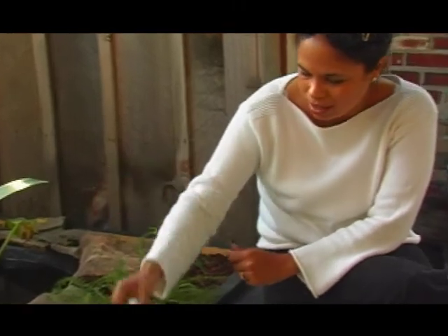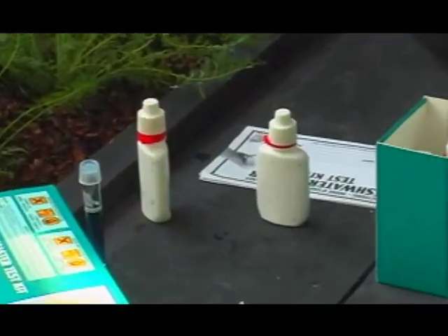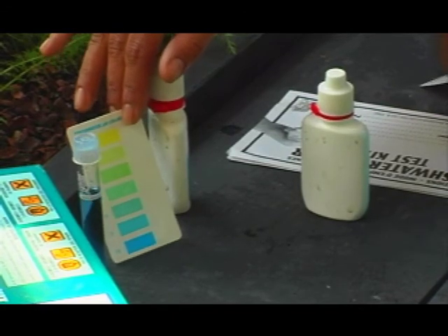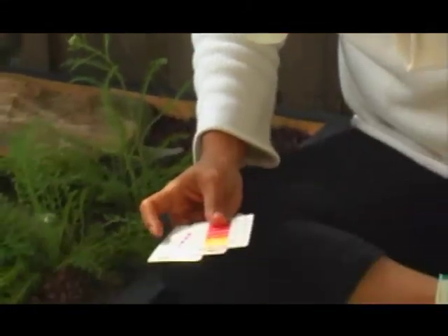That's already giving me a very, very blue reading. We're going to check this little color card and I'm going to say that we're at a 7.6. The next thing we're going to do then, since we got the highest reading, is the high range indicator solution.